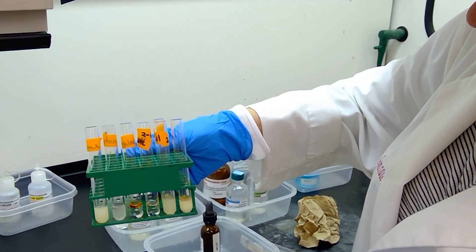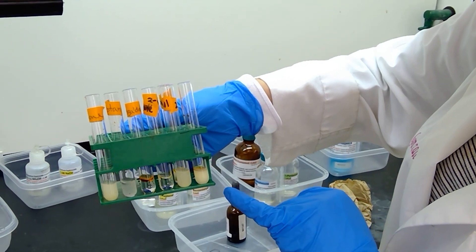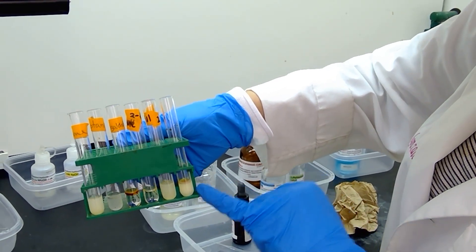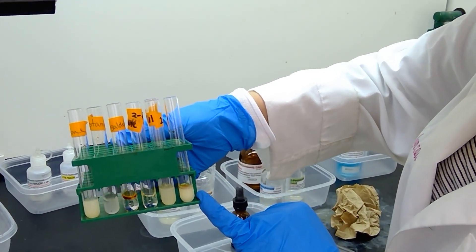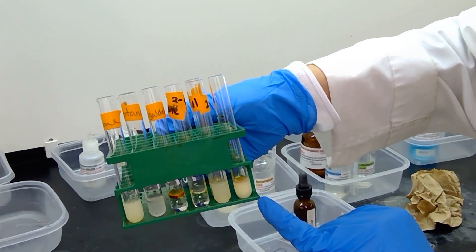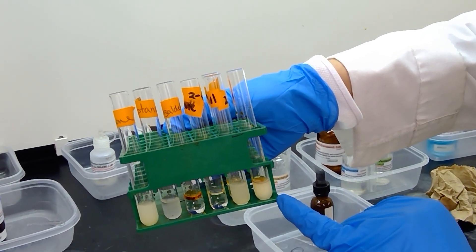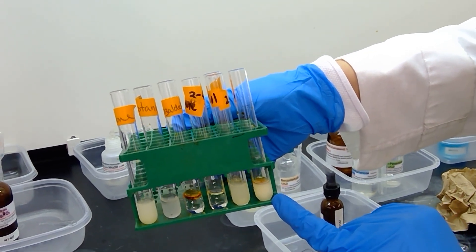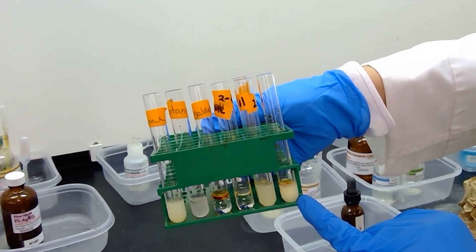So students, check this out. We redid the acetophenone sample using water as the solvent instead. And although acetophenone doesn't dissolve very well in water, what you can notice here is that we are definitely developing the yellow precipitate when water is used as the solvent versus the 1,2-dimethoxyethane.